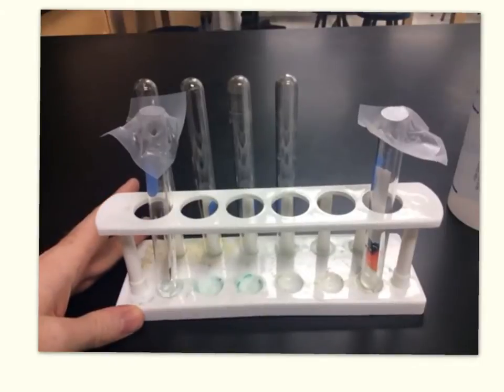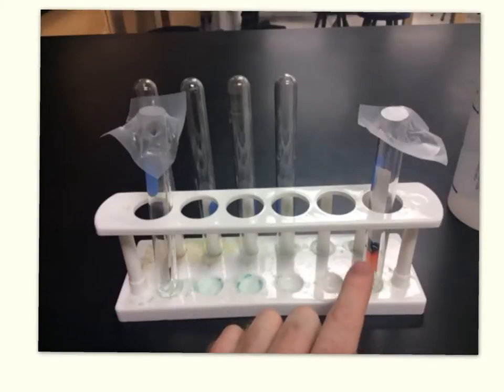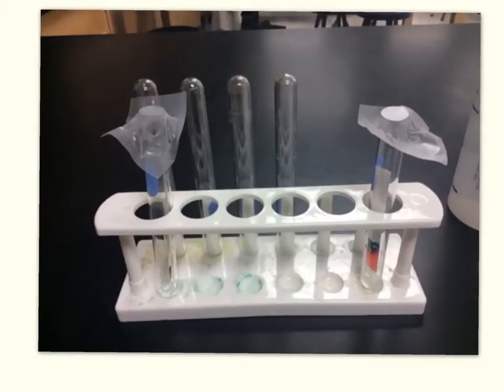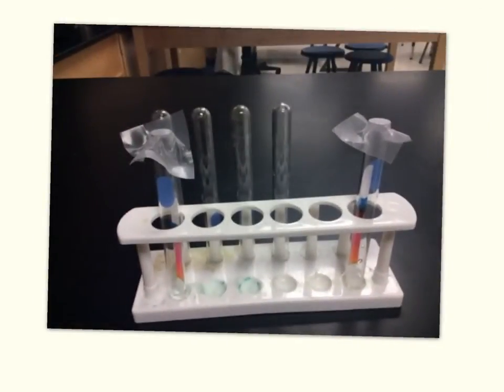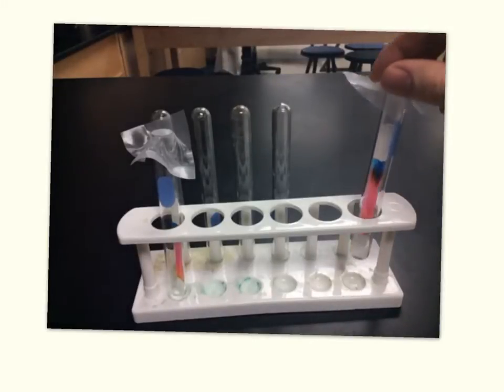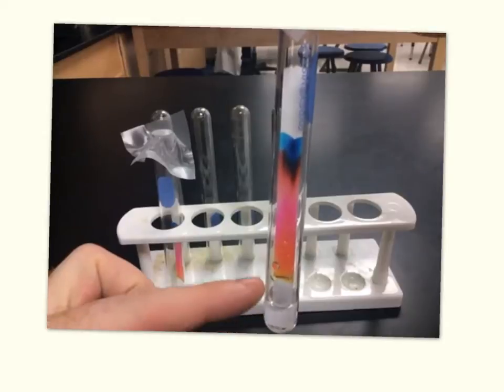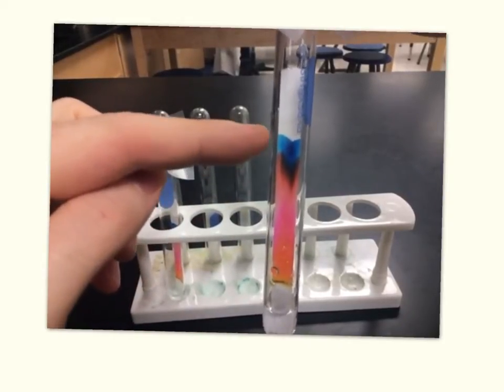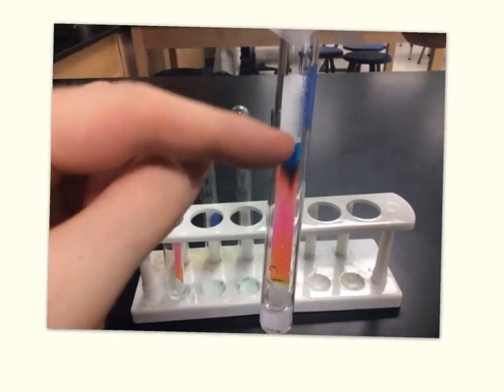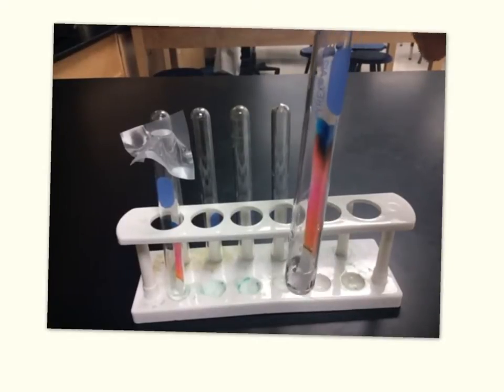Over here you can see one that's been going a little bit longer and the separation has really started to take off. Remember, this is not a chemical change because those colors were already in there — we didn't make new colors, we're just separating out the colors present in the marker. As the chromatography is running, keep an eye on your separation and don't pick up the test tube and move it around. You have to stop the chromatography before the mobile phase reaches the very top of the paper, so make sure you're keeping an eye on all of your trials as they're running.